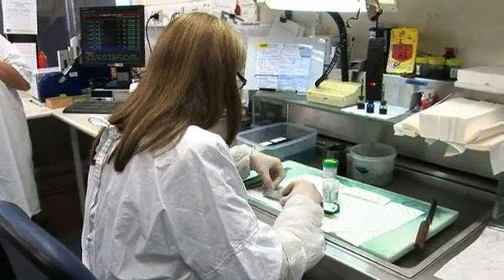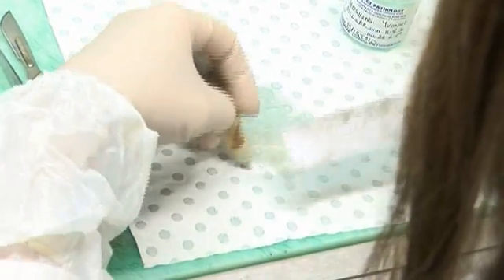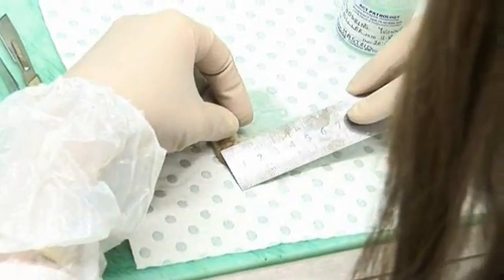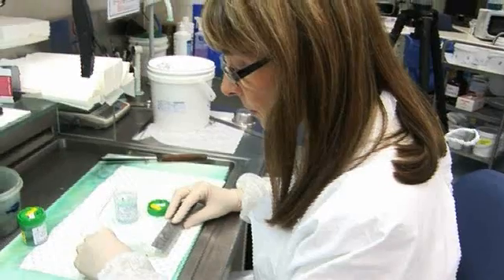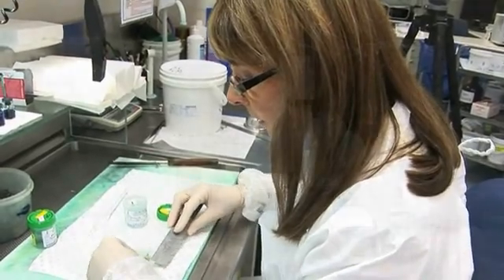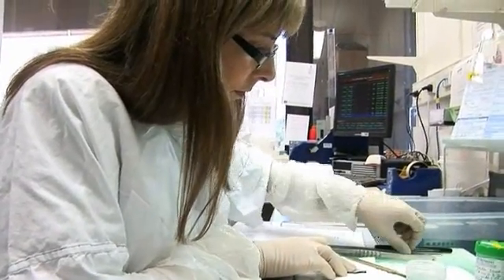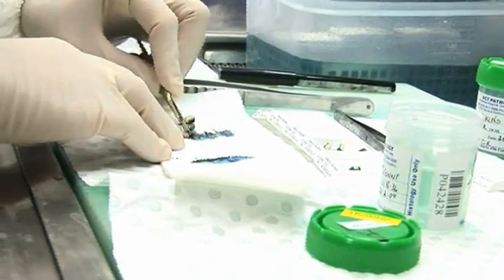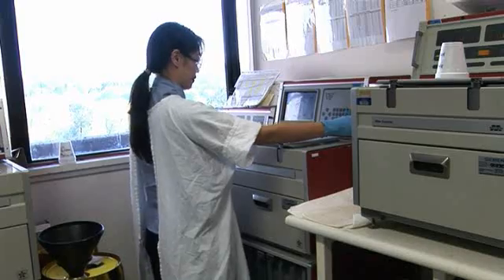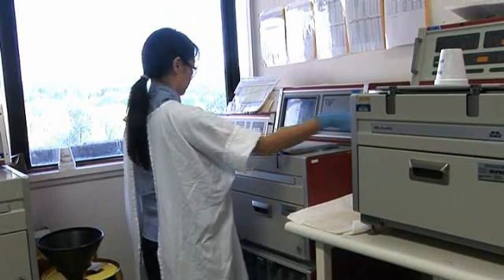On this first day, a pathologist will examine the specimen, measure its size, describe its colour and texture, and determine if there are any masses present. The pathologist then cuts the specimen into thin slices, called sections, and examines them further. Small pieces of these slices are then fixed in formalin, which hardens the tissue and prevents it from breaking down any further.